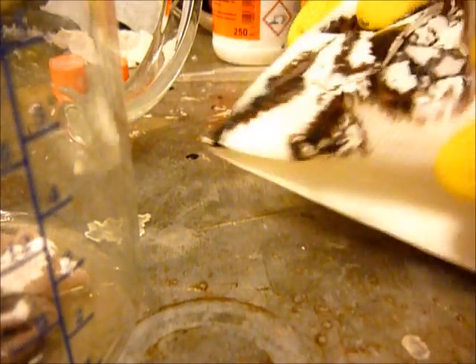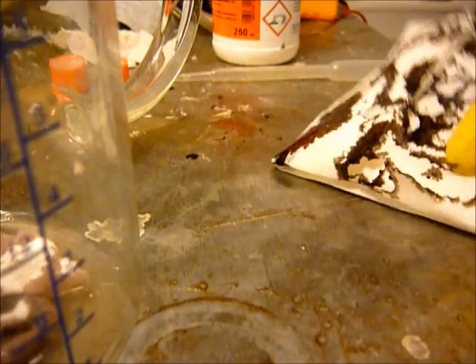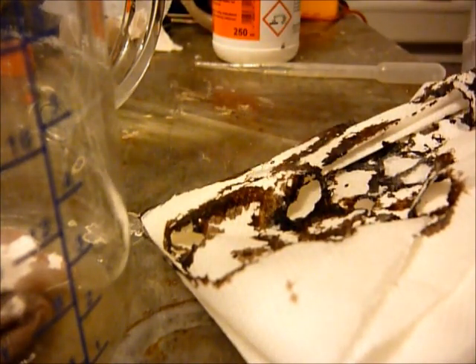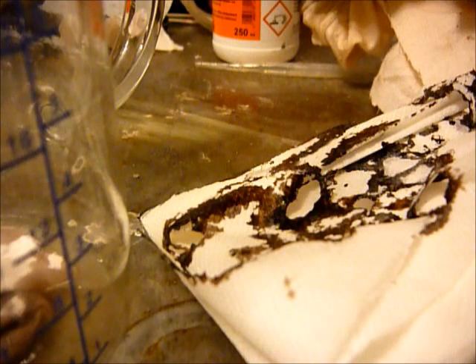So it was a very messy reaction. I'm cleaning up. Oh, don't forget the stopper of the sulfuric acid bottle.